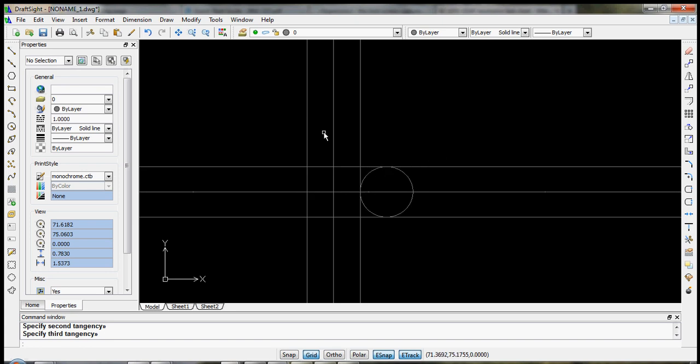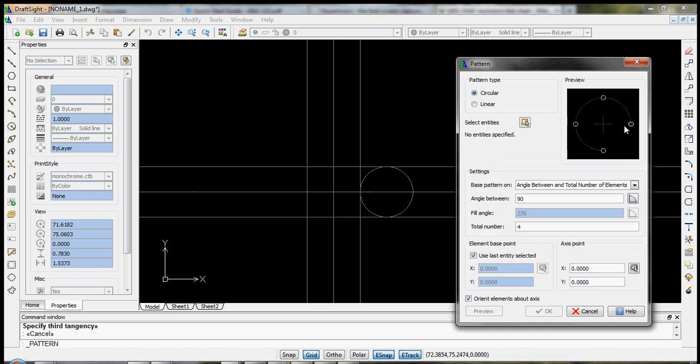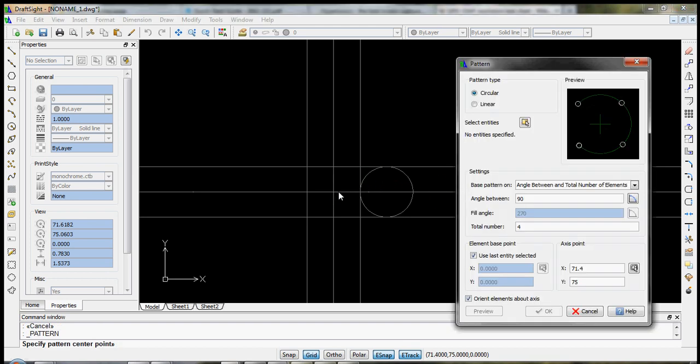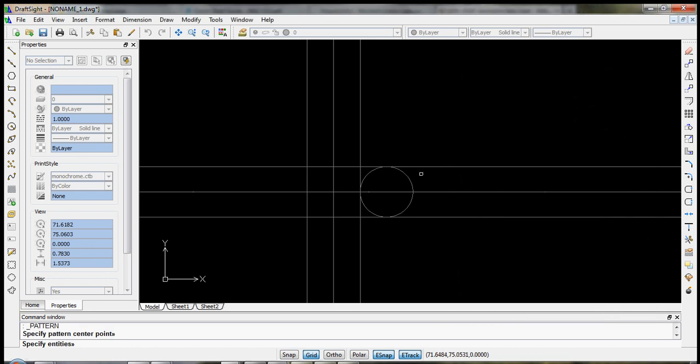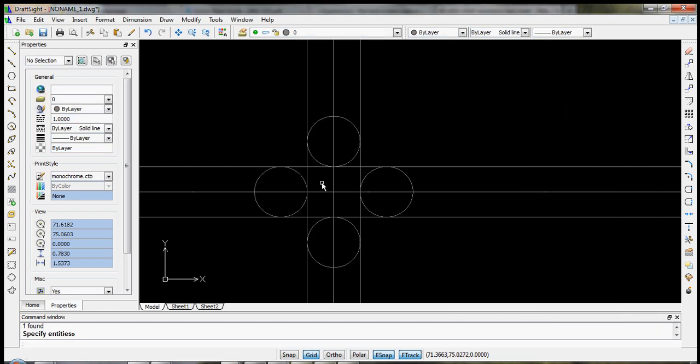So we could do that for the other 3, but we can also use the mirror command, rather the pattern command. So let's give that a try. Pattern. Again, remember we can do a circular pattern. This is looking pretty much like what we'd like to have. What we do need to do is define the axis point, which will be down here. We need to select our entities here, enter, and now we just need to hit OK. Okay, great.